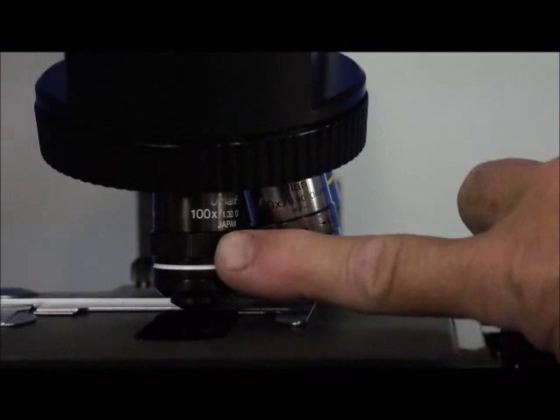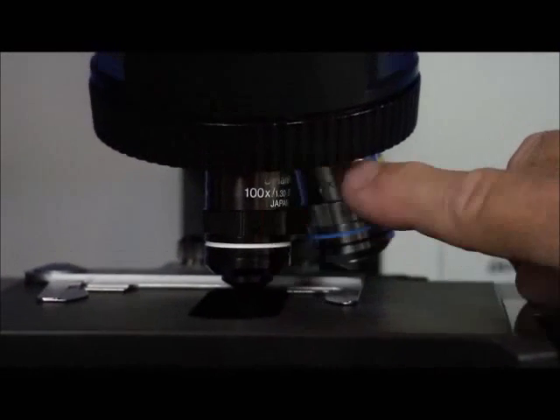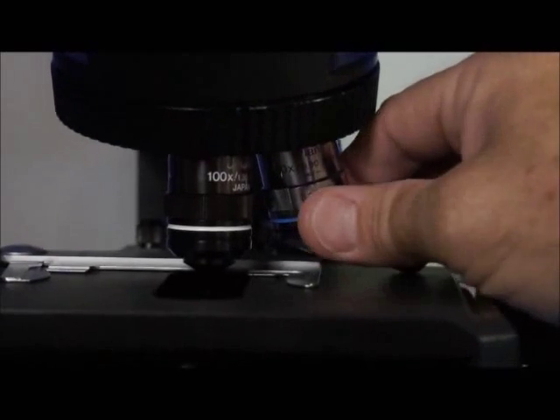The iris diaphragms are great for fluorescence. They're also great for phase contrast or for dark field.